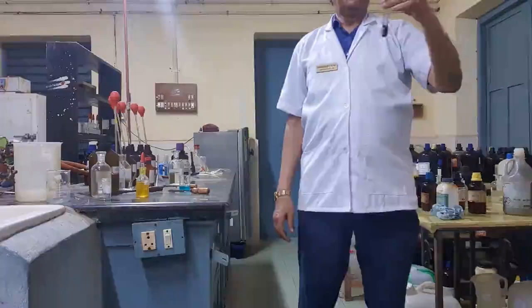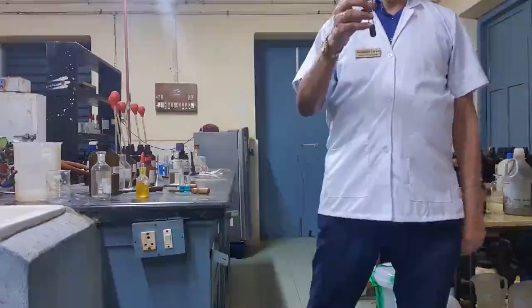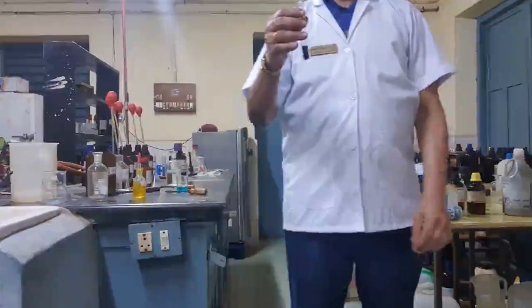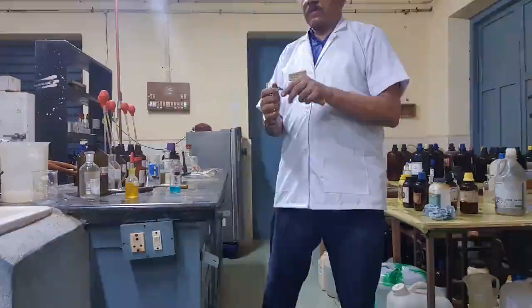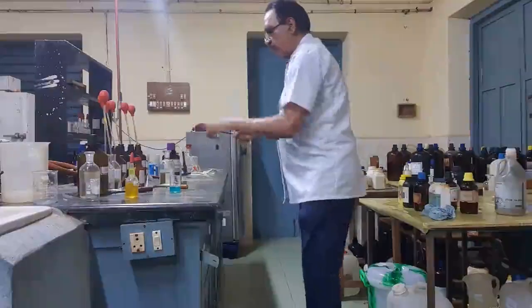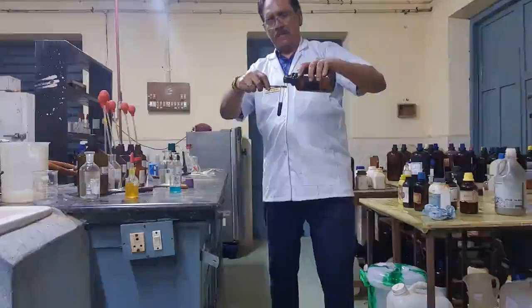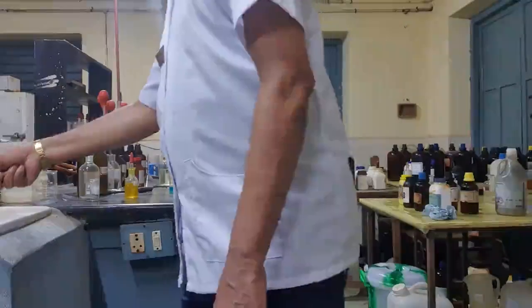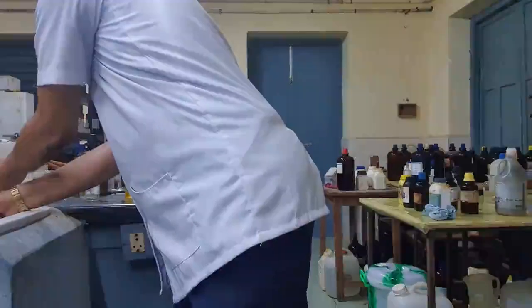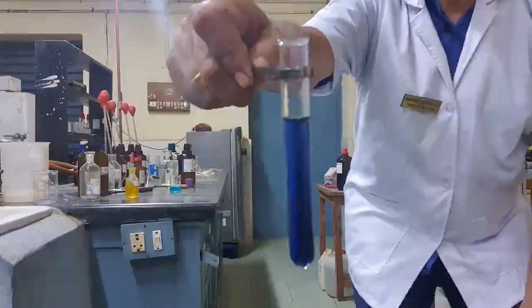After adding dilute nitric acid to the solution, I am now adding ammonium hydroxide in excess. I am getting a deep blue solution — please follow. Just see here: a deep blue solution is formed. This is the test for the copper ion.